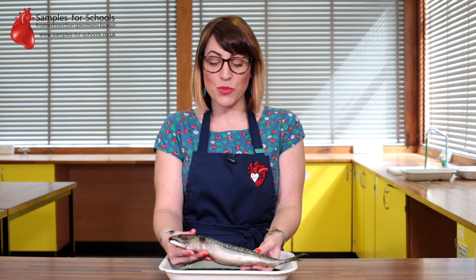Hello and welcome to Samples for Schools fish dissection. This dissection aims to look at the fish gills and how they're used in gas exchange. I'm going to be dissecting an entire mackerel. Your sample can be of a larger fish and just the head if you'd prefer.